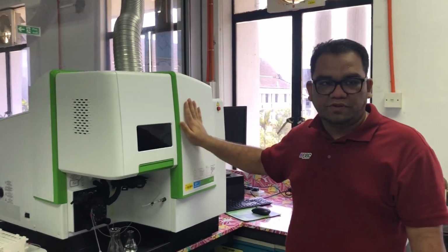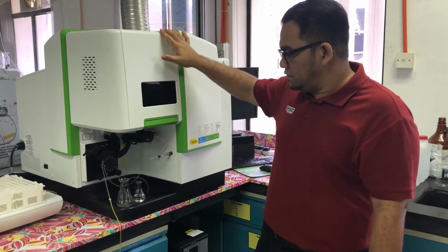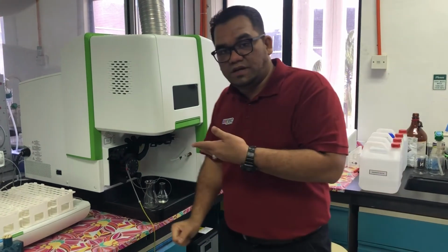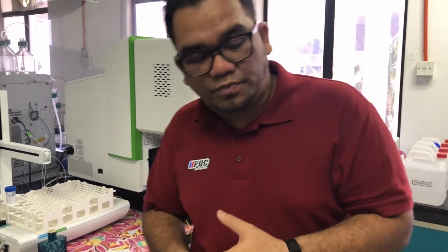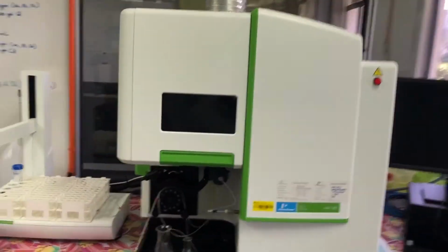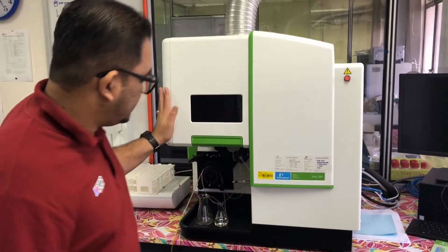What is the difference between ICP-OES and ICP-MS? The detector, right? We also have a similar plasma part here. The plasma generator is here, and then we have the OES, optical emission spectrophotometer, inside here. The instrument is slightly cheaper than ICP-MS because for the setup we only need an optical emission spectrophotometer rather than a mass spectrophotometer. This instrument we just bought within this year, but it is already ready for any analysis. We have done a lot of analysis using this instrument, right?